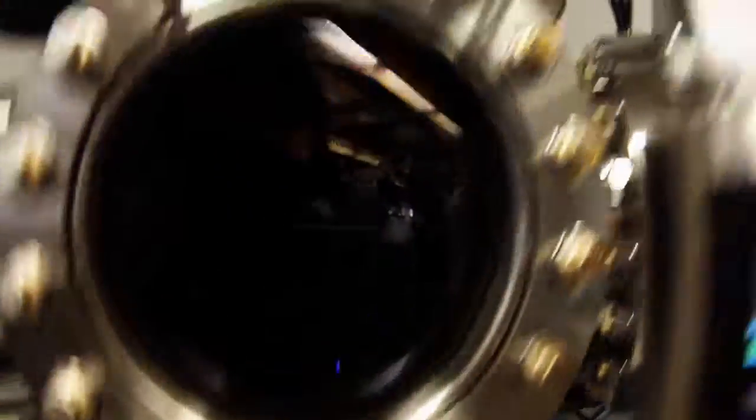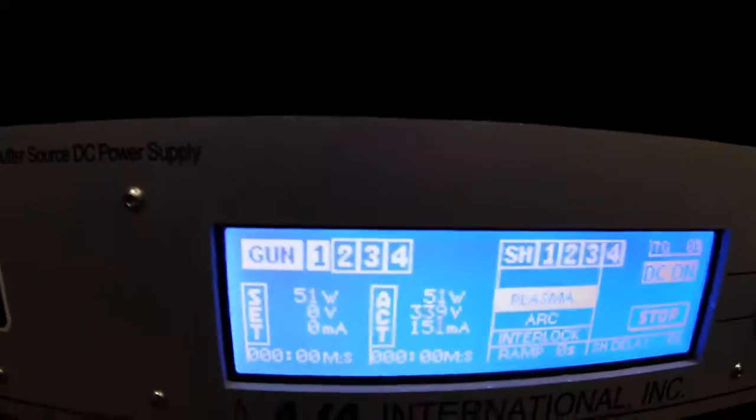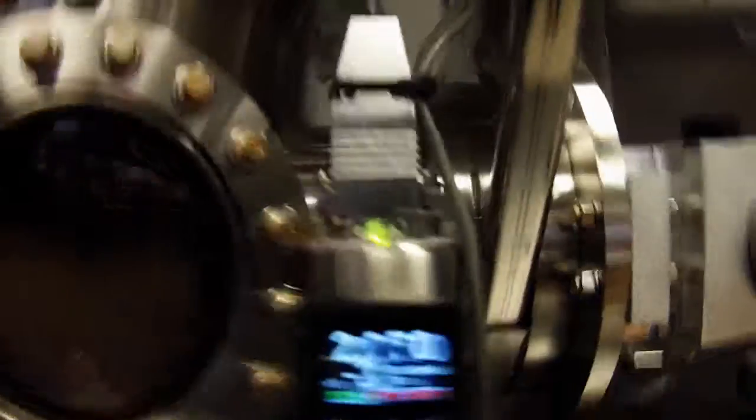Let's stop the QCM and end the process, then close the gun shutter. Turn on the lights and move the QCM back. The plasma is still lit so we're going to gradually power it down back to 50 watts and then turn it off. There it is back down to 50 - turn it off. Plasma's off - confirm it's off. Turn off the gas, you see the pressure rising. Now open the gate for the turbo and you see the pressure decreasing because the turbo is opened up to the main chamber.